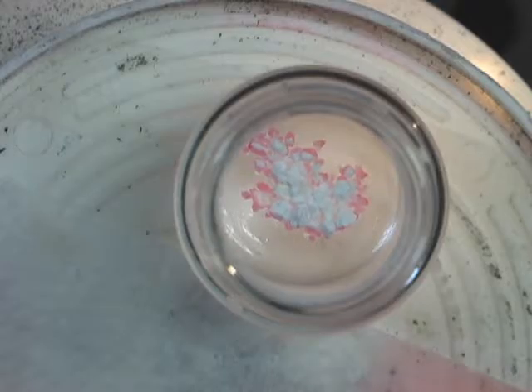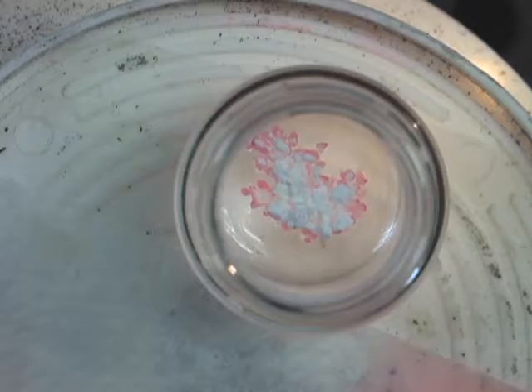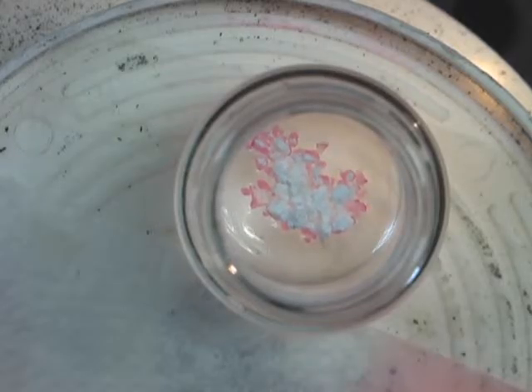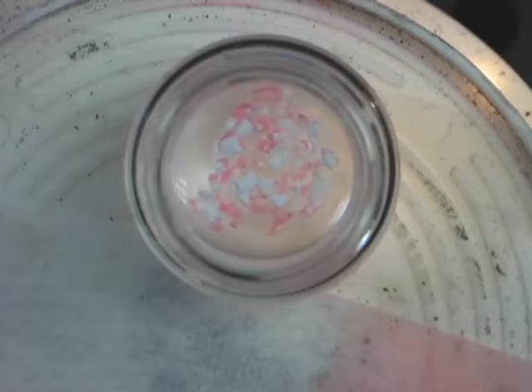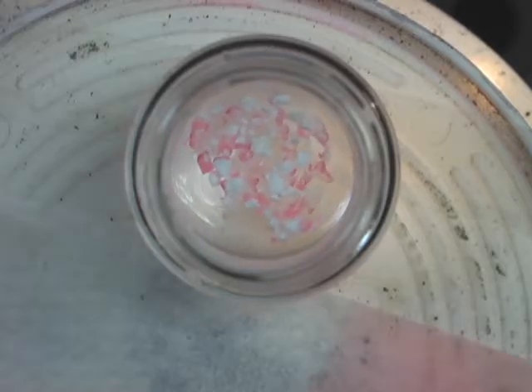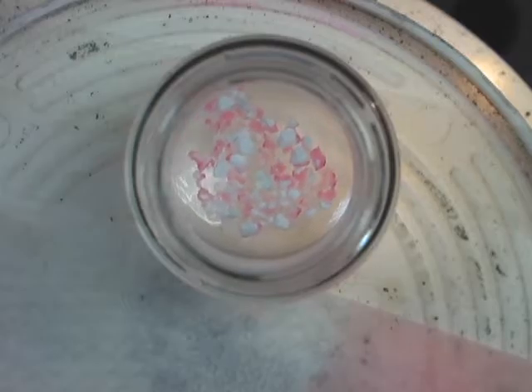Of course, in the field, this process will happen even faster because of the natural motion of the material in the oil. This we can simulate with additional shaking. Even after a few seconds, one can see that pretty much all of the oil is absorbed. The remaining white nanomaterial indicates an excess of material was used relative to the oil needed to be absorbed.